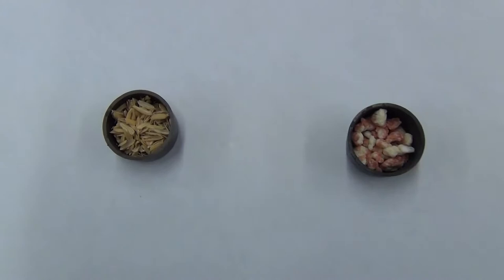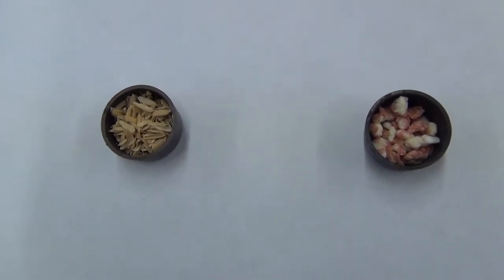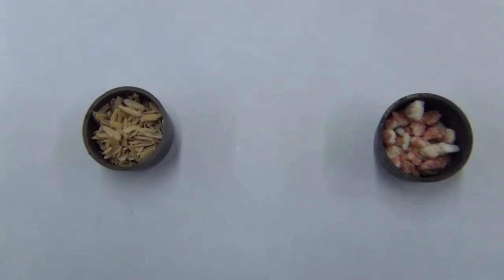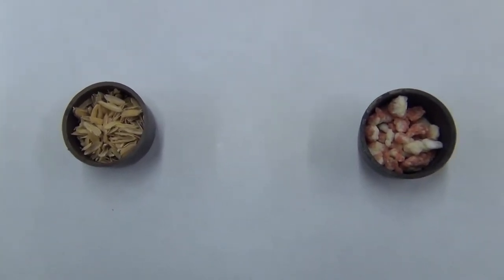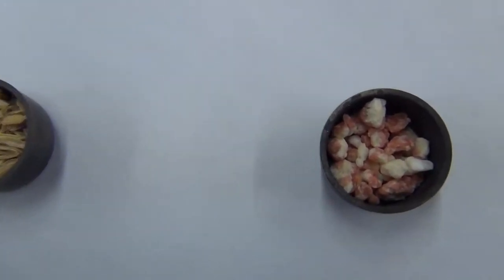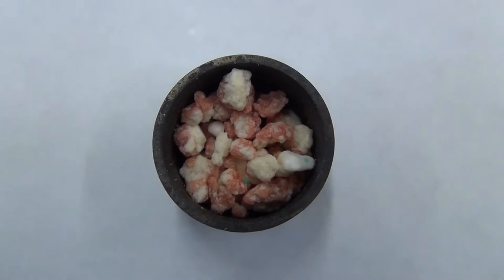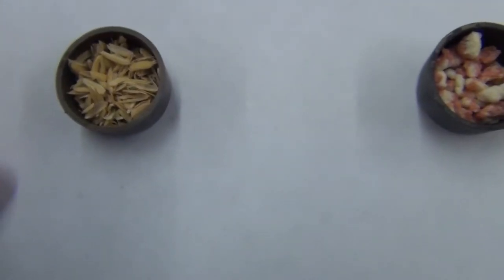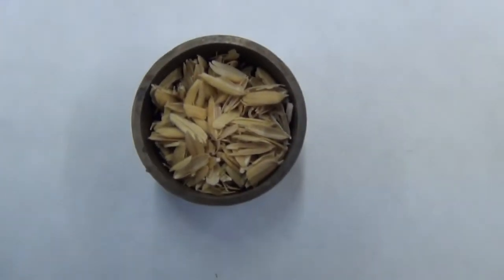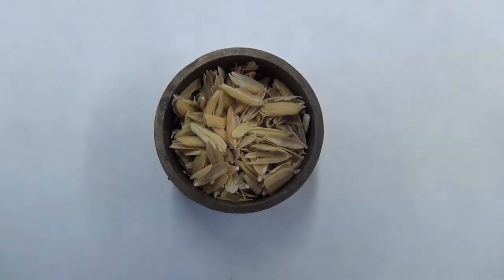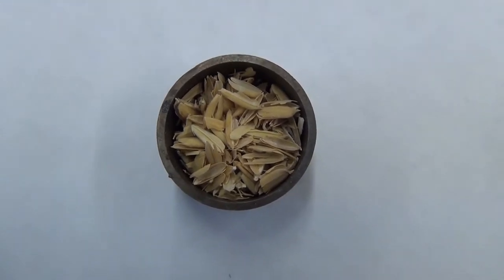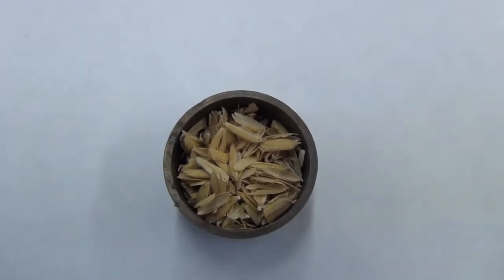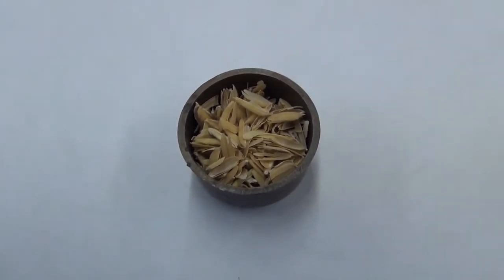Here's our fuel. The fuel can be anything we want. In the past we've looked at actual fuel like gasoline or diesel, food, peanuts, crickets. Most recently we looked at pop-tarts, frosted versus unfrosted. And possibly this quarter, I'm looking at rice husks or what I sometimes refer to as the additive for the new soylent green bars.